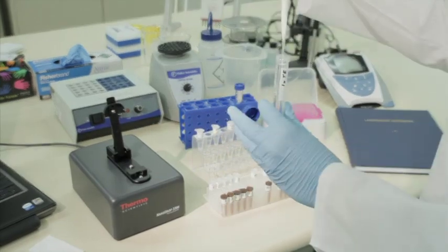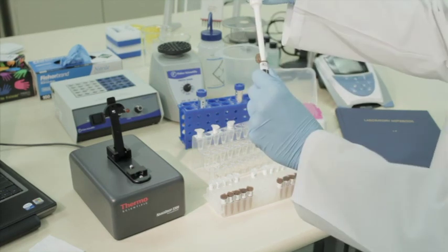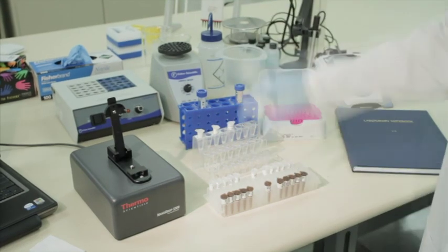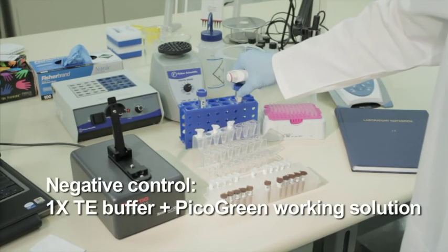Combine equal volumes of 1X TE buffer and pico-green working solution to prepare the negative control, which serves as a reference solution.